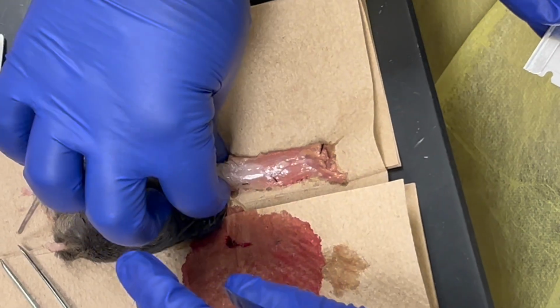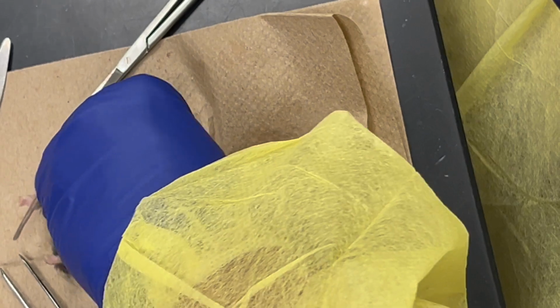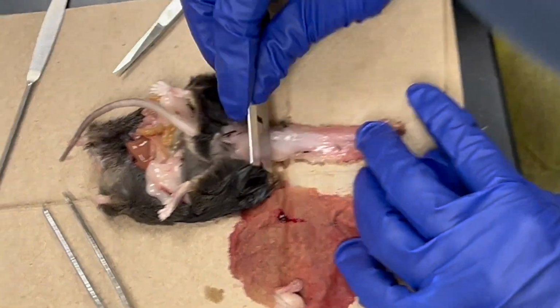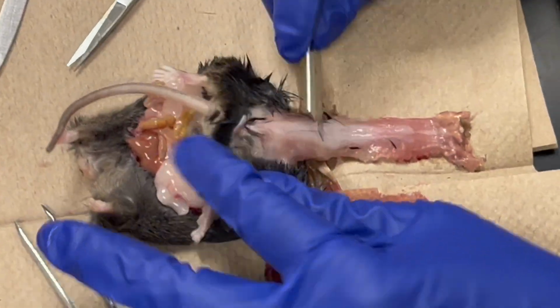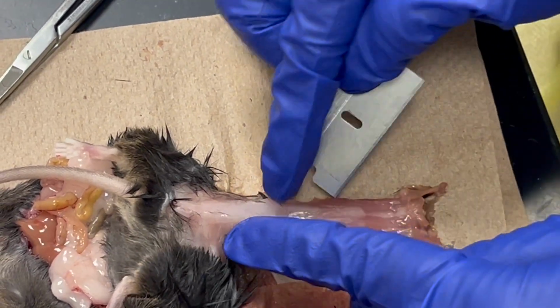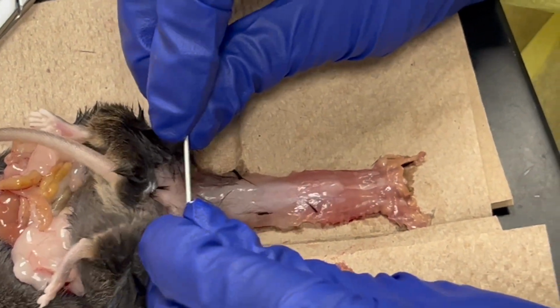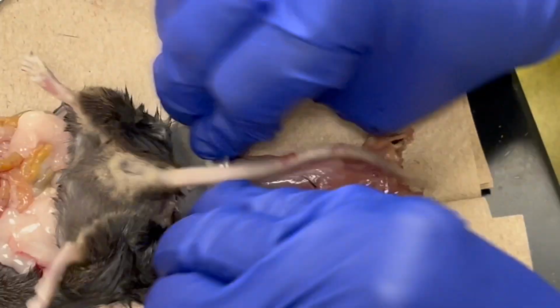Yeah, there's like a ridge. Do you feel where you cannot go anymore? Yeah, like here. So you're cutting right there. Then the other landmark is honestly here. Look at this muscle. Here, you'd see things are more like that. So this is usually my length, and I'll try to go like this.